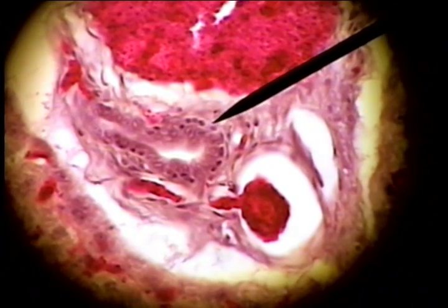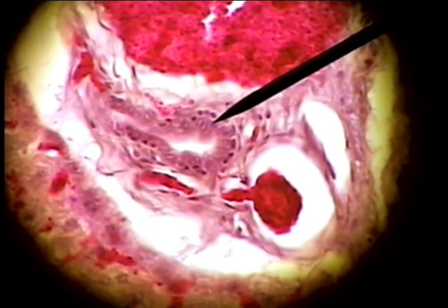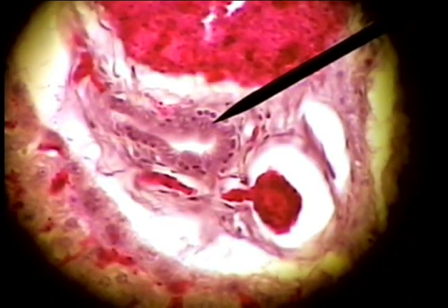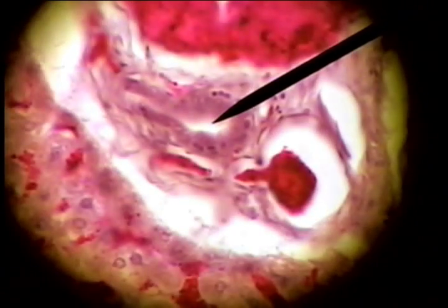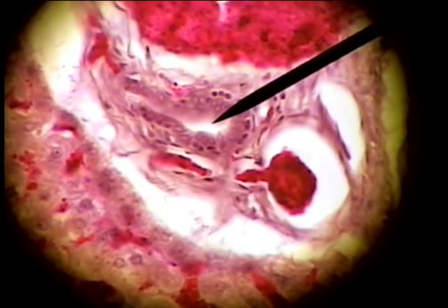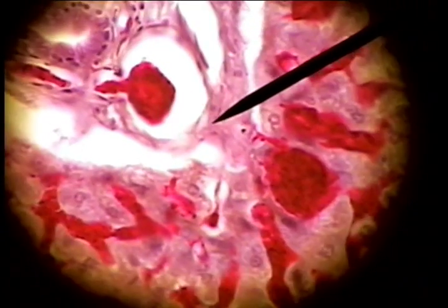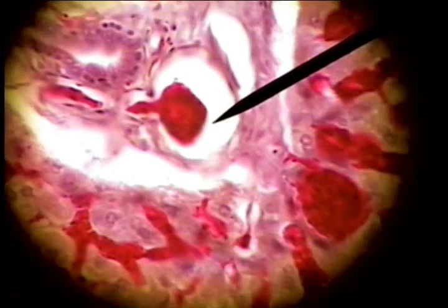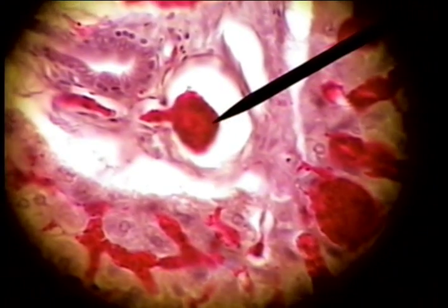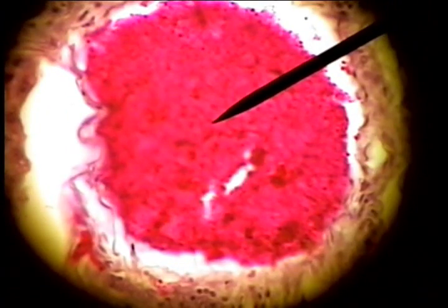Here's the basement membrane of the duct, the nucleus of the cuboidal to columnar cells, and the lumen of the bile duct. This is simple squamous endothelium on the inner surface of this hepatic artery, so there's some blood in the hepatic artery, and then the very large portal vein.